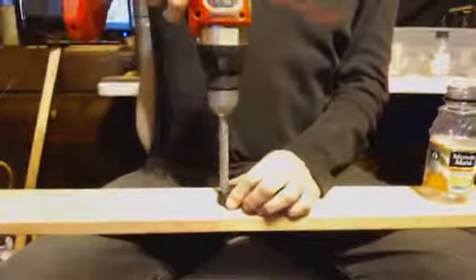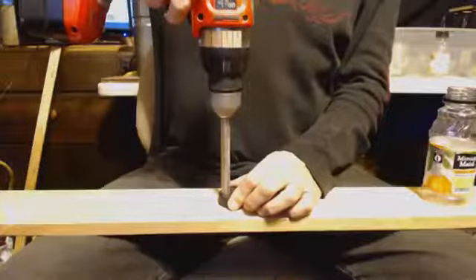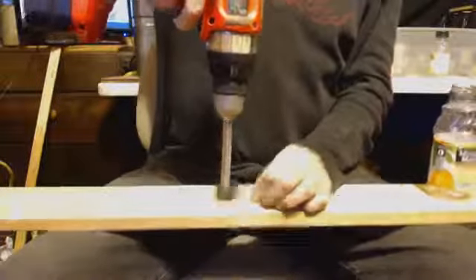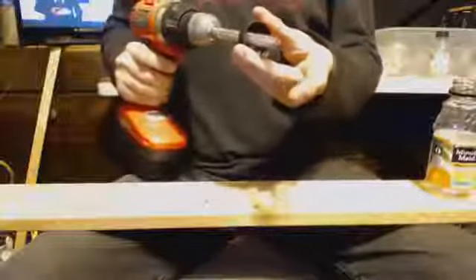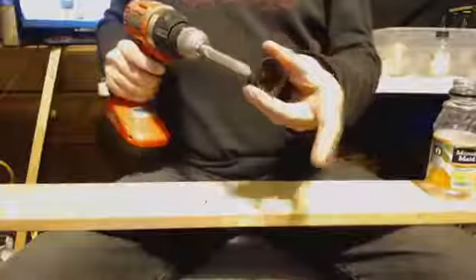And when you do this, don't hold that cap real hard. Just hold it softly, so when it takes off on you, you don't take your hand with it. Do it nice and slow. Don't gun that drill up.